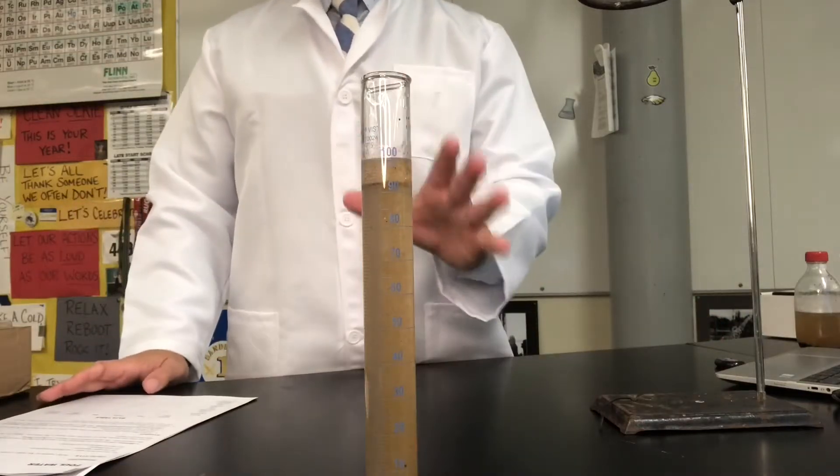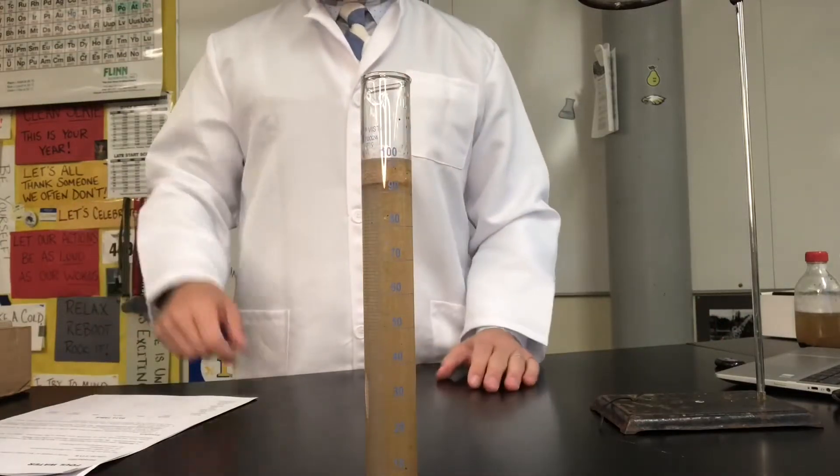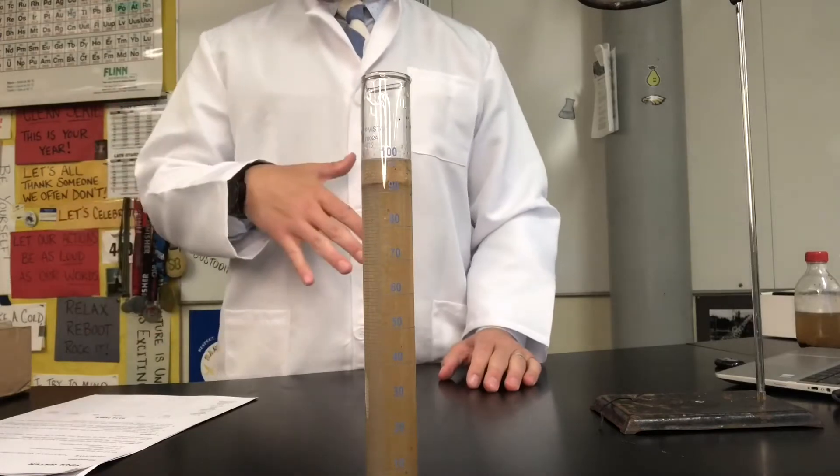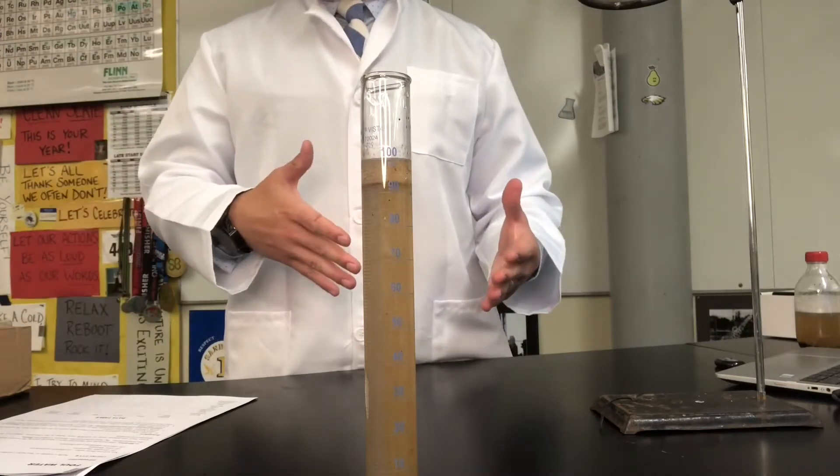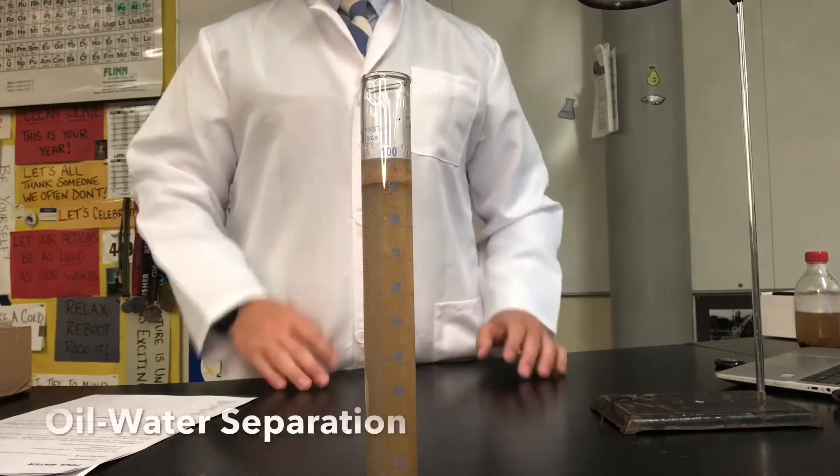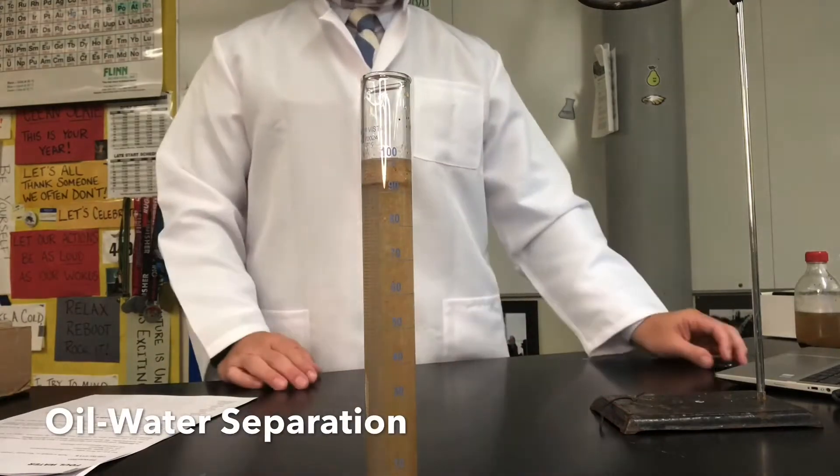We've started our initial before treatment observations in our data table. Now we're going to work to our next part of the lab which is going to be oil water separation. After we do that we'll then take data again.